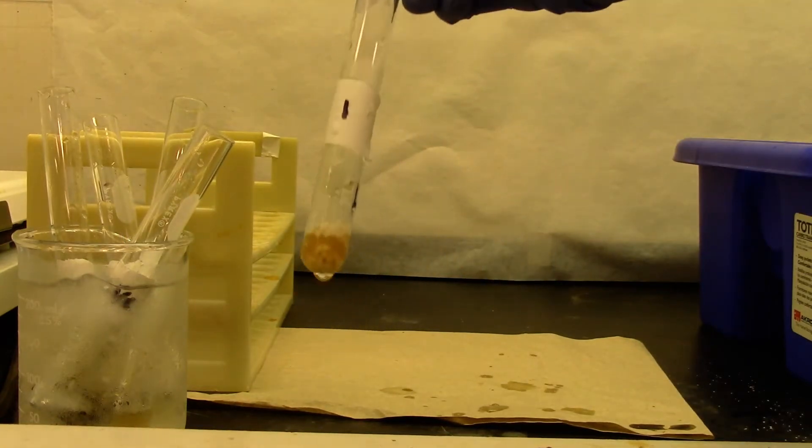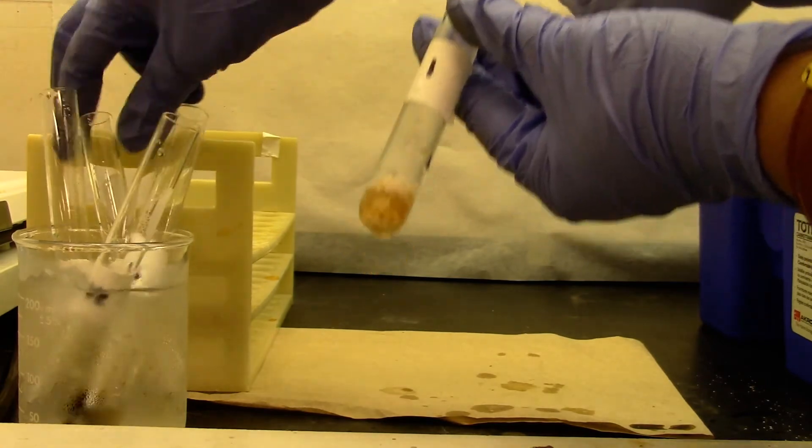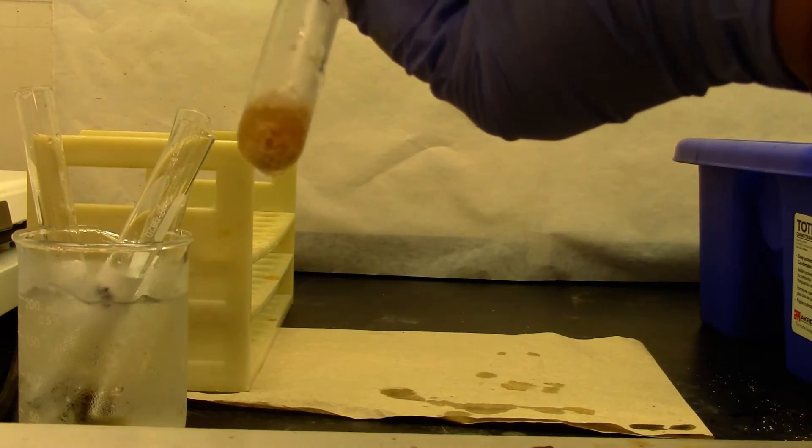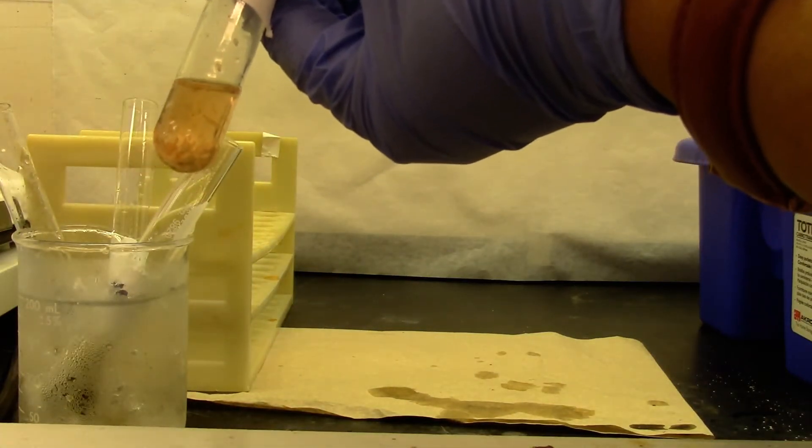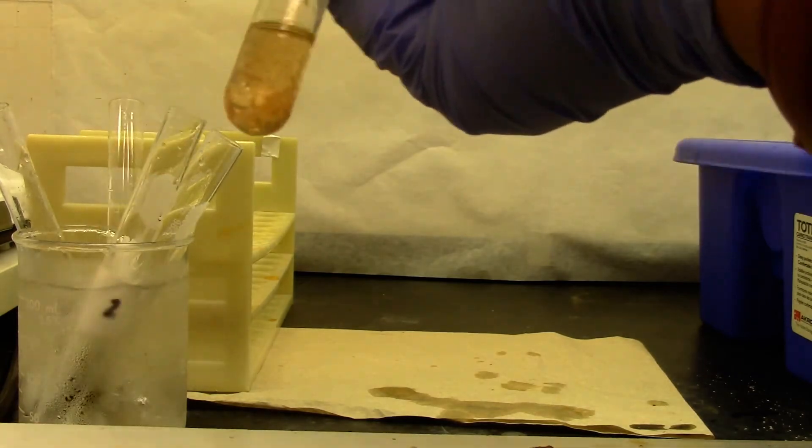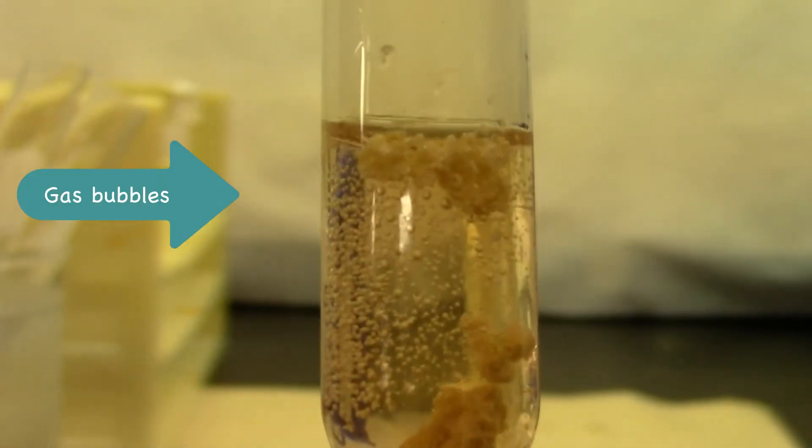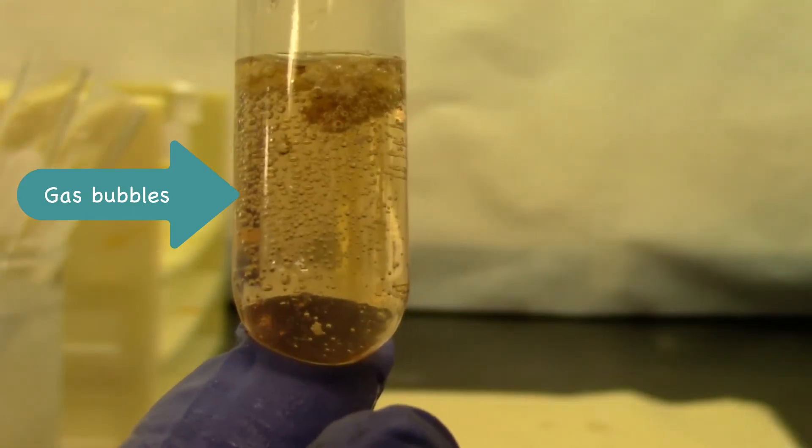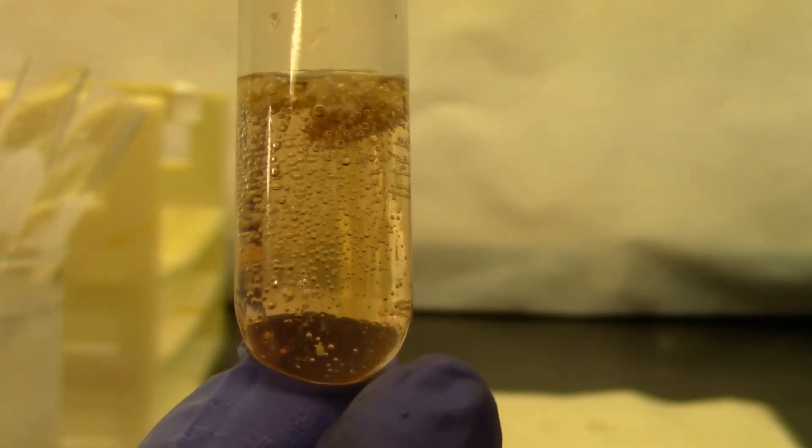Right now it has been cooling. That is my aniline solution. To this, I am going to add my sodium nitrite and we will see how it looks like. I am adding my second solution, which is sodium nitrite. Gas formation indicates it is a primary amine.